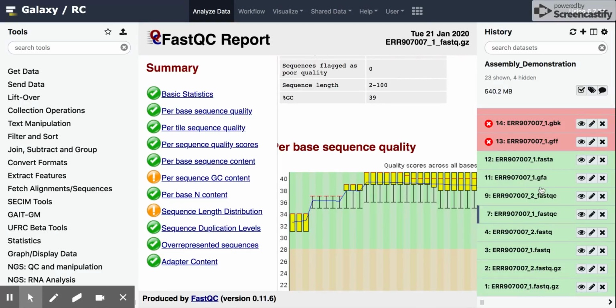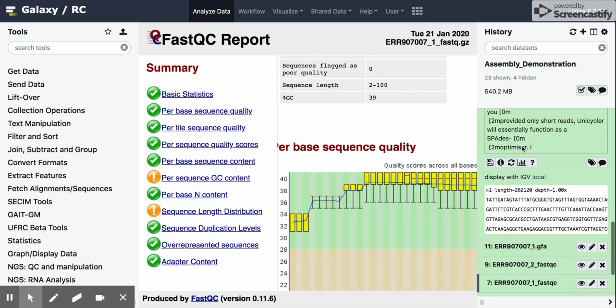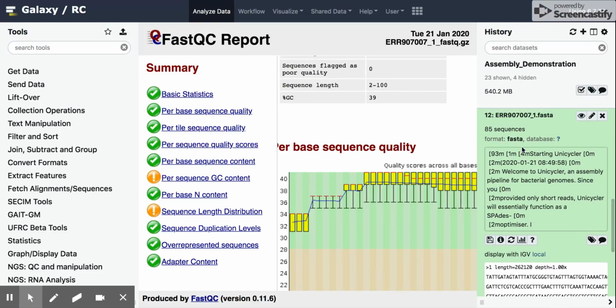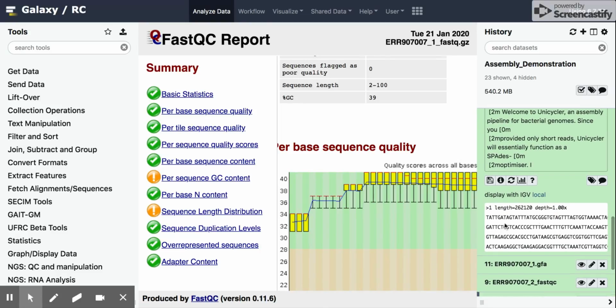Last, we have the GFA file, which is the assembly graph from the de novo assembly that was created using Unicycler, and then also the FASTA file. So this is your assembly. And if we click the drop-down, we'll see that there's 85 sequences in here. So our SPAdes run that was optimized using Unicycler produced 85 contigs. And you can get an idea of what the FASTA file looks like.